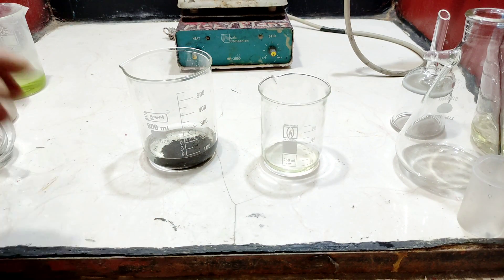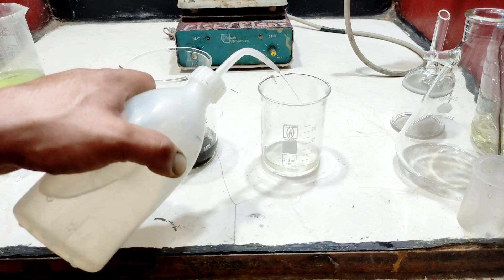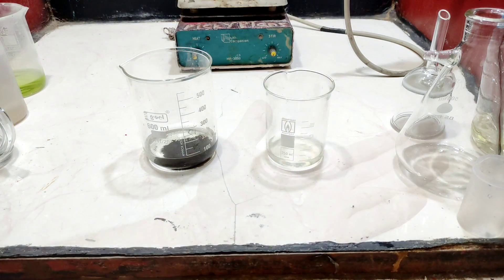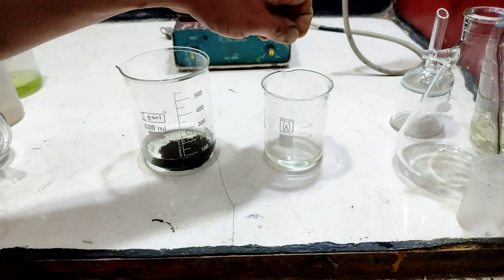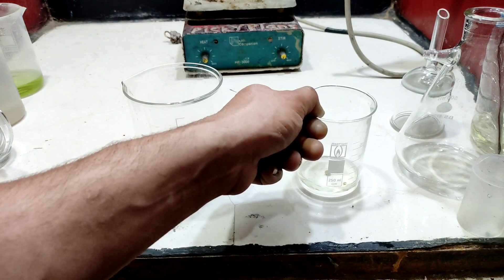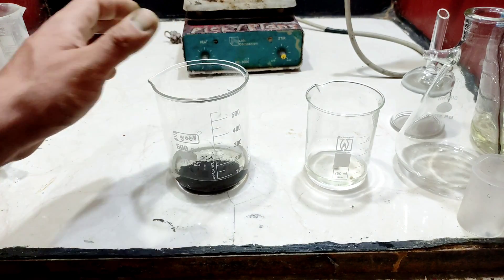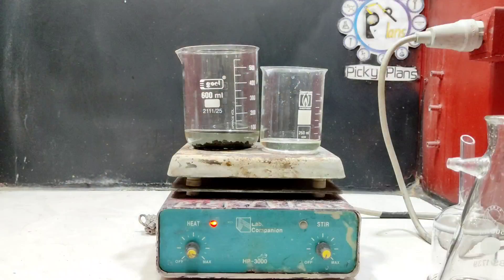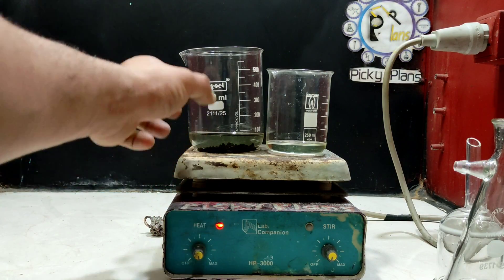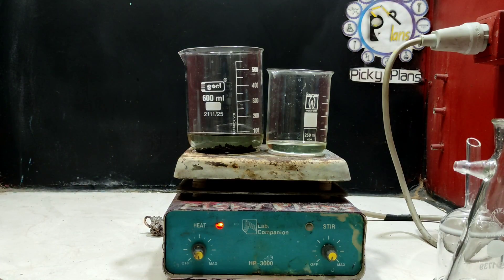For the second batch I have about 20 milliliters of hydrochloric acid, diluted a bit. I've already hammered the two gold beads to provide more surface area for acid digestion. The total weight of gold for this batch is one gram. After warming the solution I will start adding nitric acid drop-wise to begin digestion of the gold.